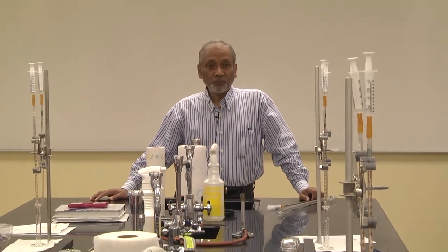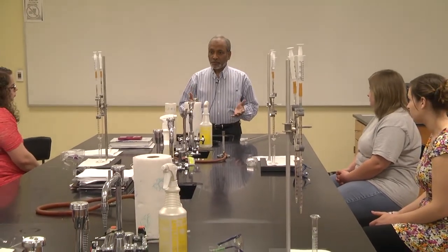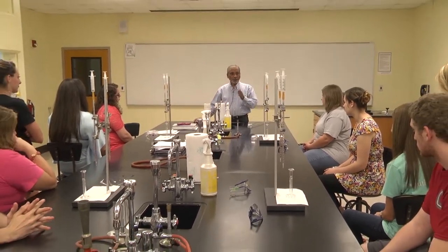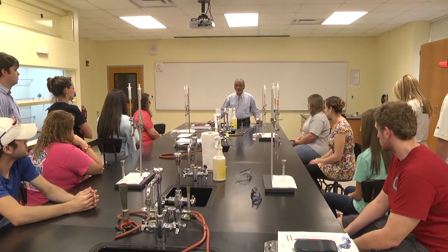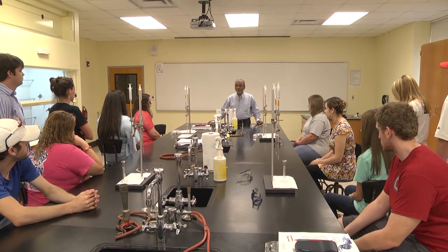So that means the vinegar is 5% acetic acid. So you are going to calculate the percent from your calculations, and then you will compare, and you will see whether you get 5% or you get more or less. So you will compare your result with what they are saying, that it is 5%. Okay? All right. Any question?